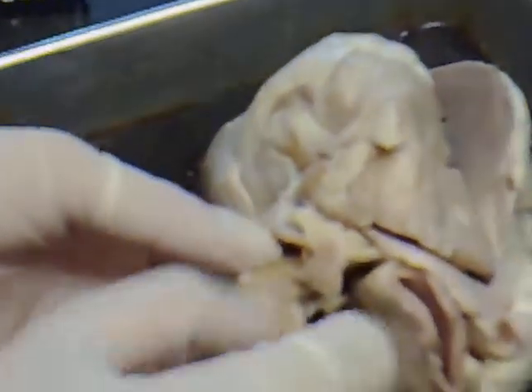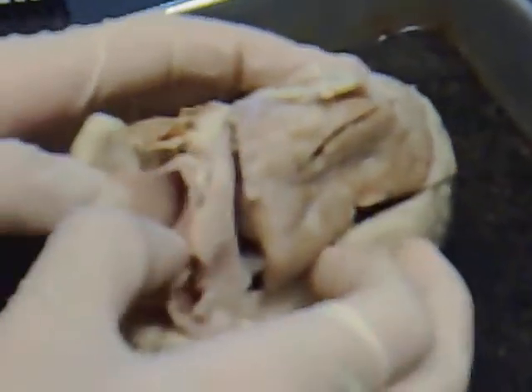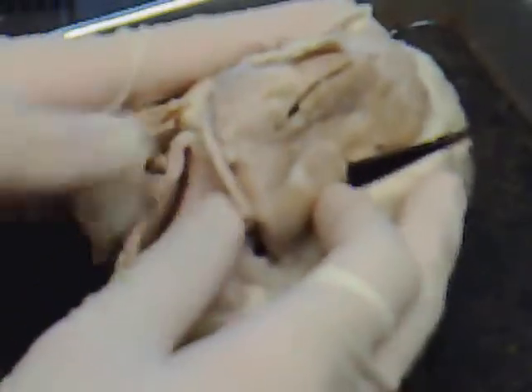And then the superior vena cava disappears right here, and the aorta is right here — oh, it looks like a mouth! Anything else? I think that's it. Oh, and that's the apex. That's it, I guess.